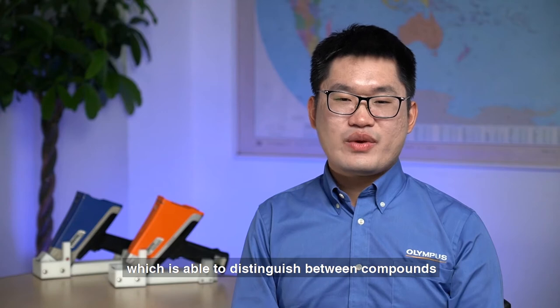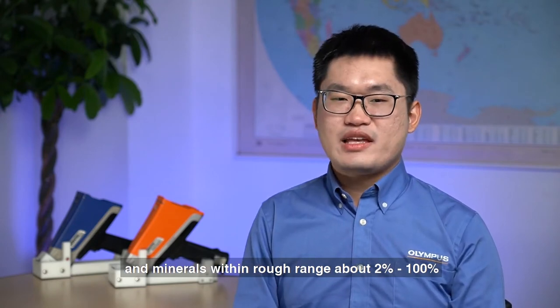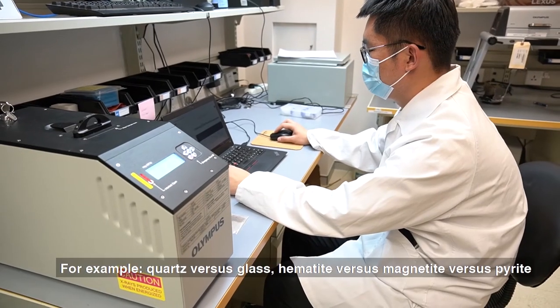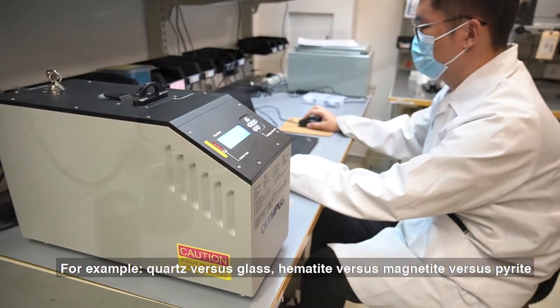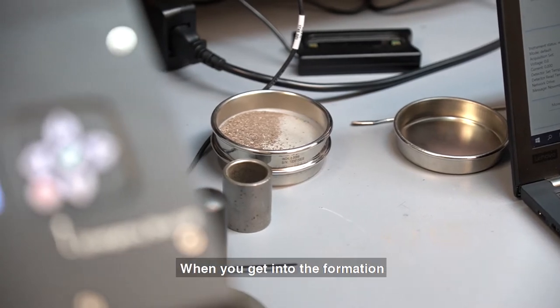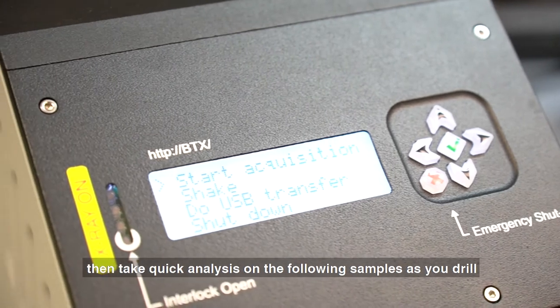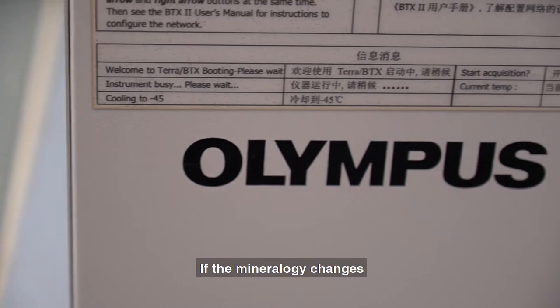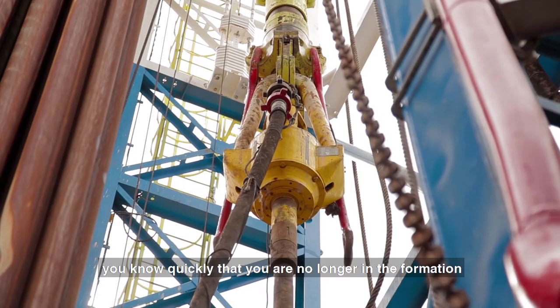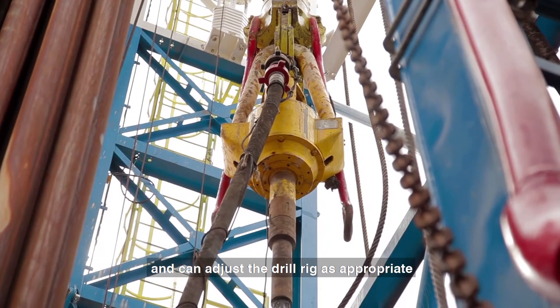XRD is a quantitative mineral-based analysis, which is able to distinguish between compounds and minerals within rock samples — ranging above 2% to 100% — whereas XRF cannot. For example, quartz vs. glass, hematite vs. magnetite vs. pyrite. When you get into the formation, spend a minute characterizing it, then take a quick analysis on the following samples as you drill. If the mineralogy changes, you know quickly that you are no longer in the formation and can adjust the drill rig as appropriate.